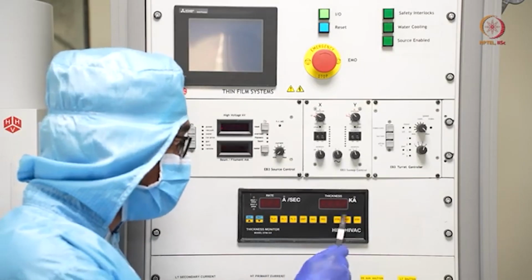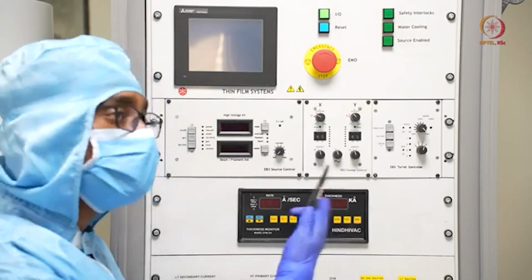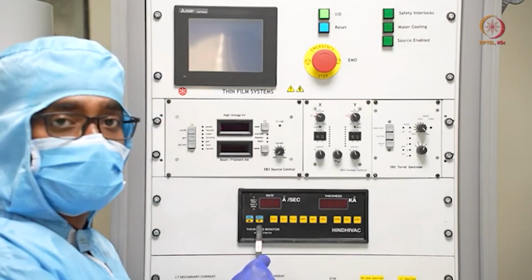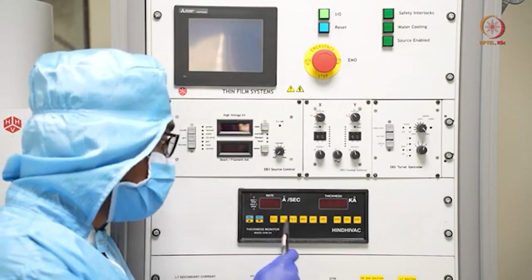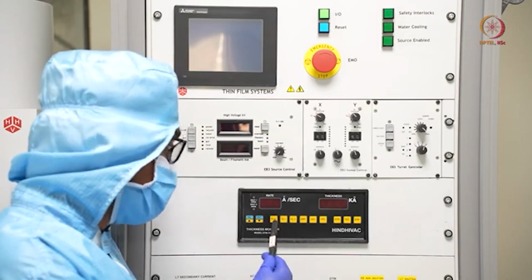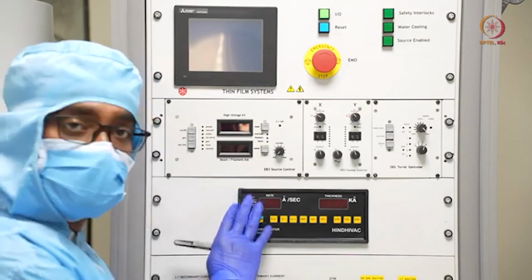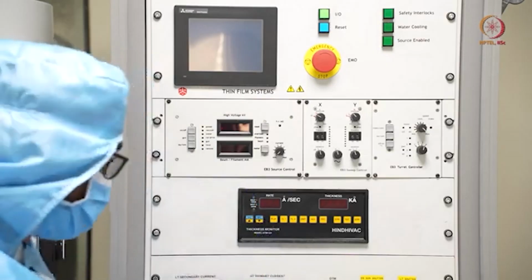These two we will get, and this is the controller, like start, stop and test, for refreshing or for starting the thing. And increase and decrease, these two are useful to give the input about film number and about these things. So this is how we are using this DTM or digital thickness monitor.